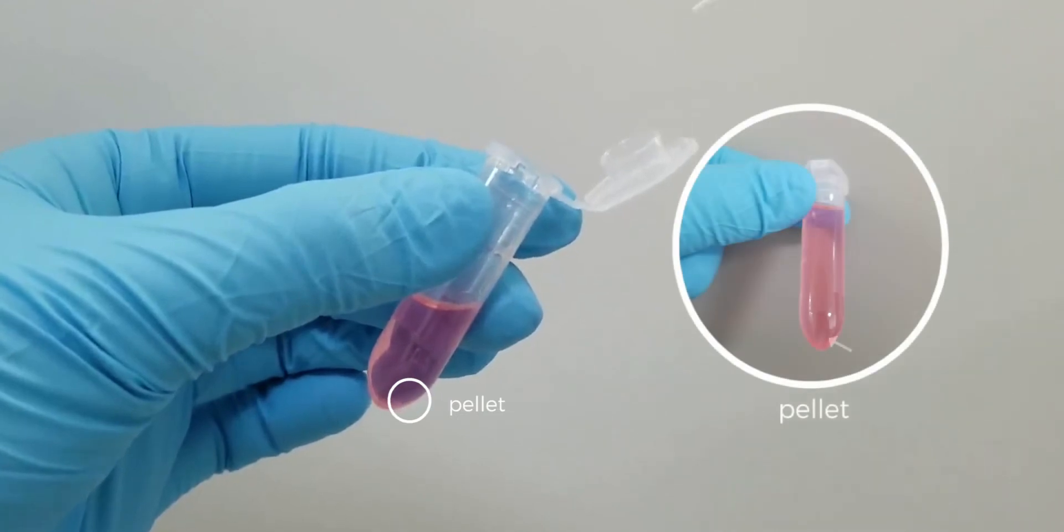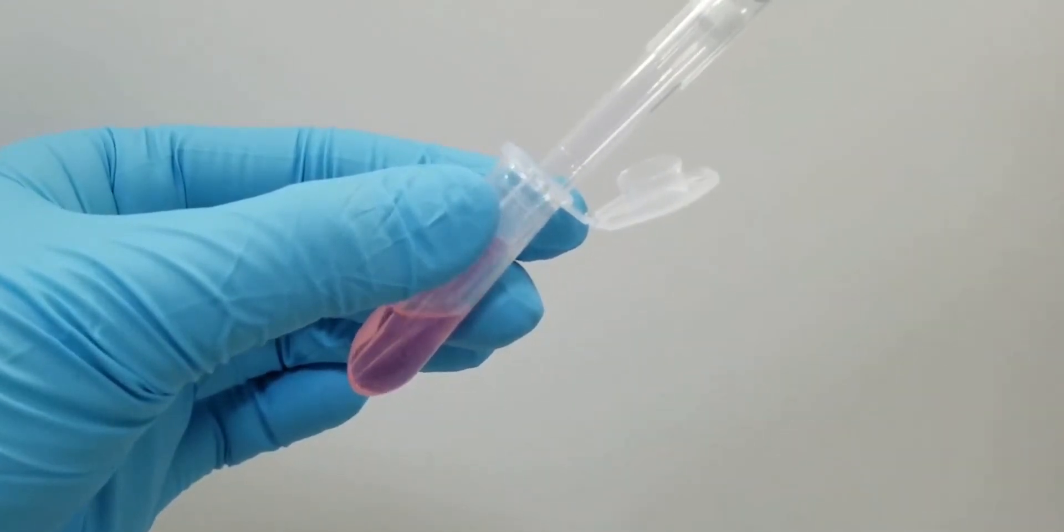After centrifugation, carefully remove all of the supernatant and avoid disturbing the pellet.